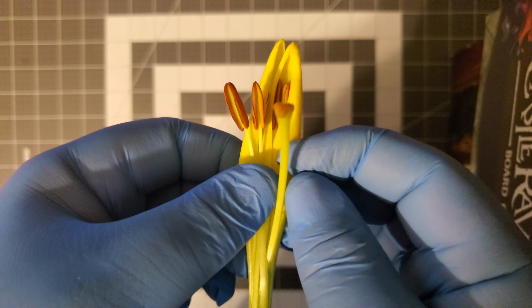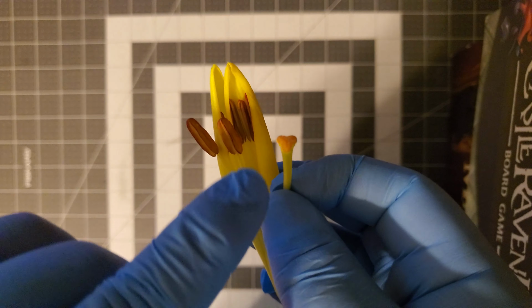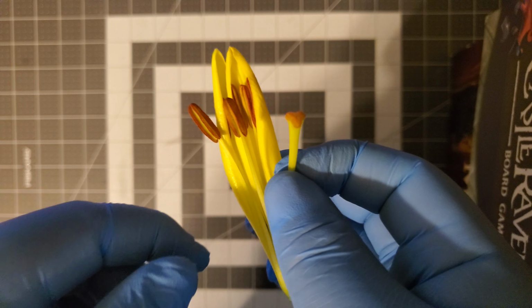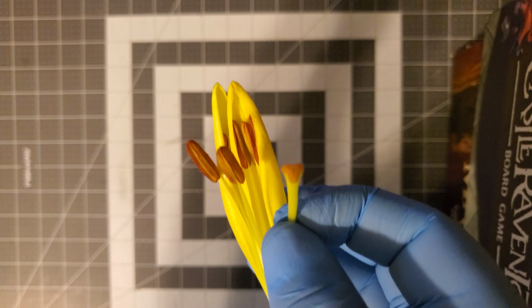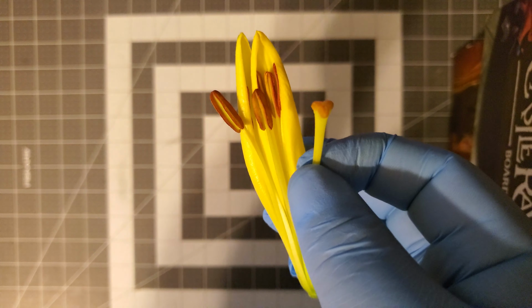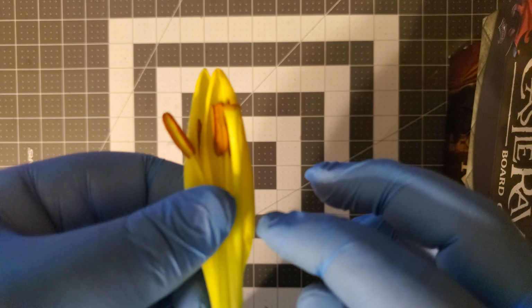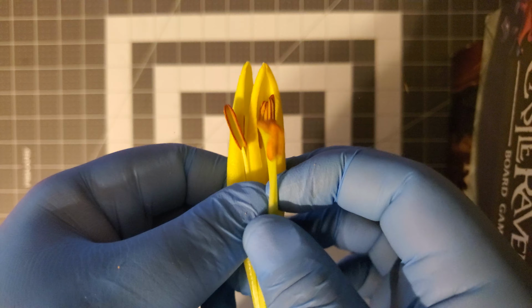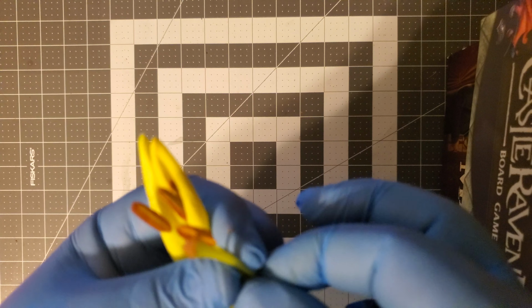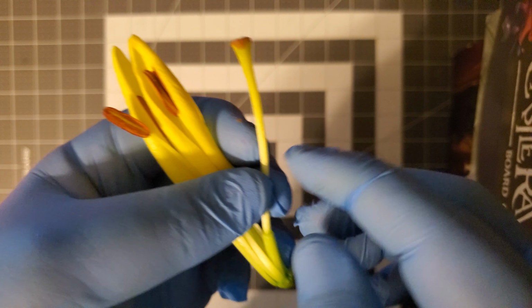Compared to the model that you showed, I don't think the stigma up here on the pistil is fully developed, but I can tell that that should be the stigma. And the style is basically the large part, which is like the fused tissue of the ovaries, I believe. Yeah, the fused part right here, the style. It looks healthy.